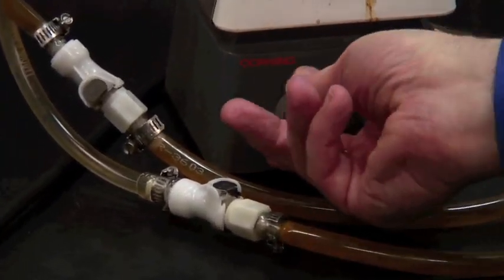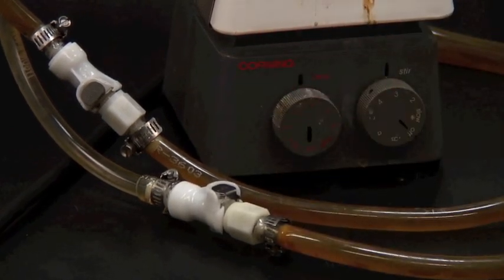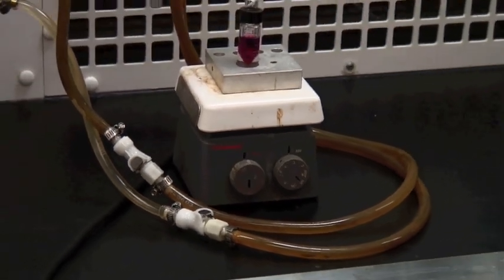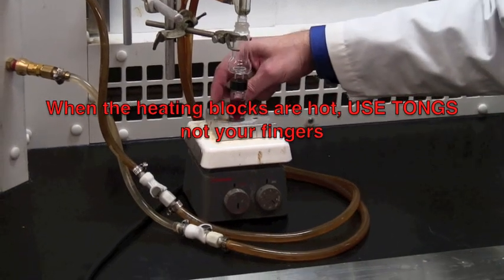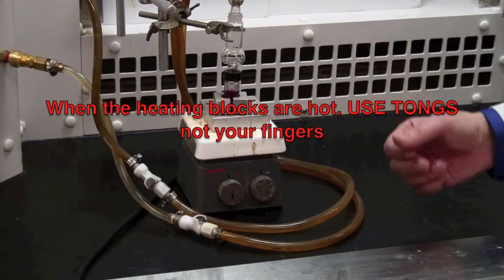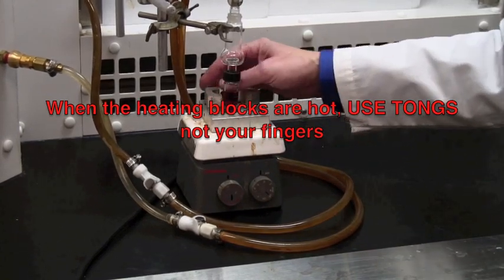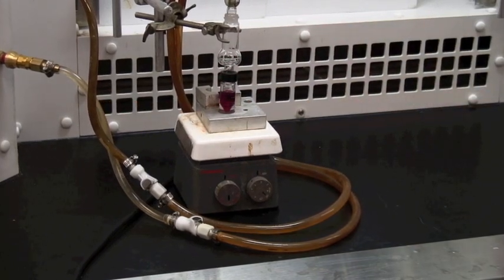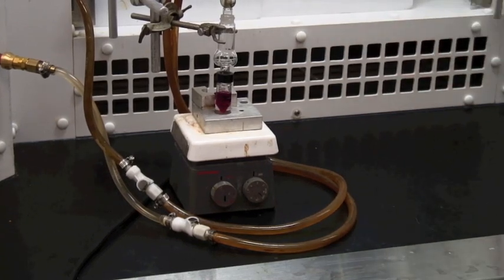We're now ready to start heating. I'm going to turn this on, and we'll start heating my mixture. Now, if you need to heat more strongly, remember we have the heating blocks that you can arrange around the outside, and that will increase the heat transfer to the medium. And at this point, we heat until it starts boiling.